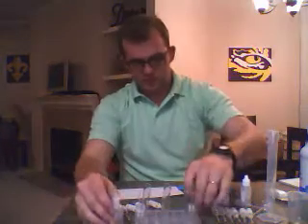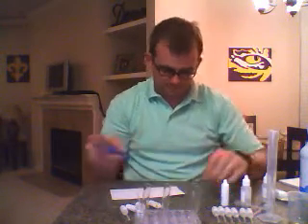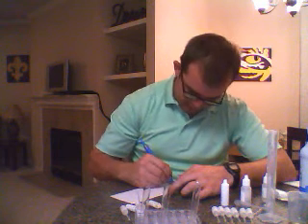Alright, so test tube number 2. Well, the first one, I want to take notes.